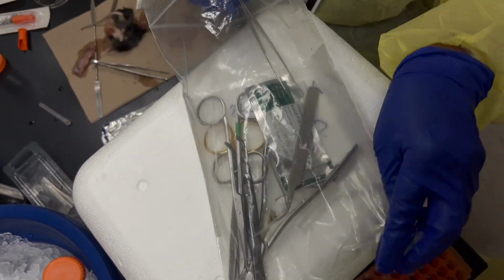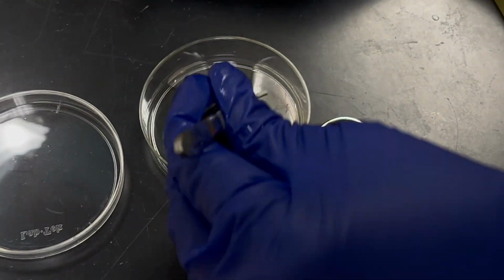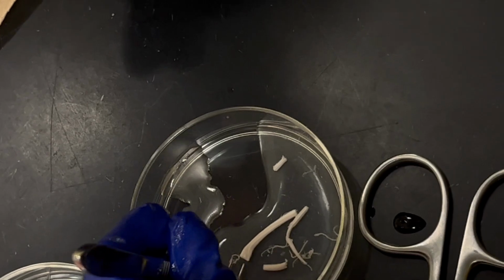Did you practice before? We said no. I wanted it to be a little bit harder so that I don't know how I'm doing it. Exactly. If it's this broken, I can still collect tissue.